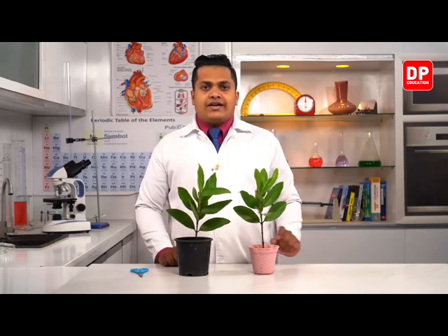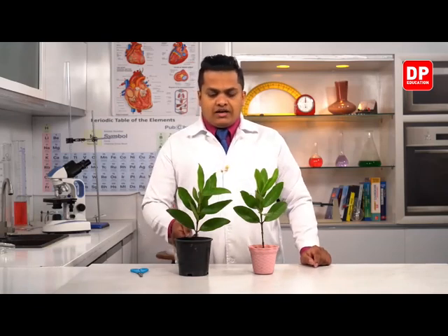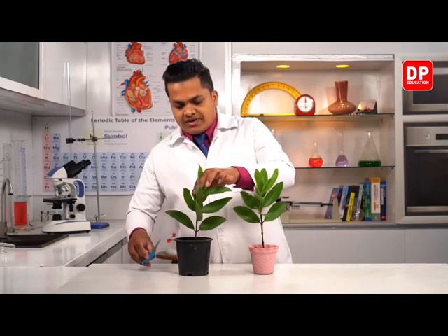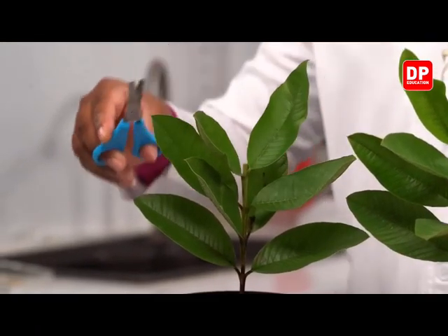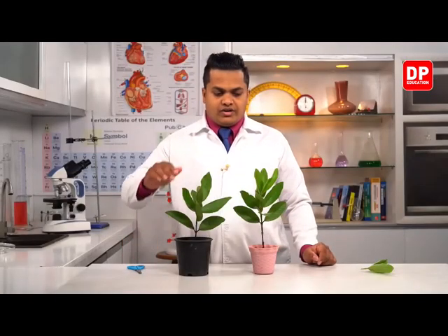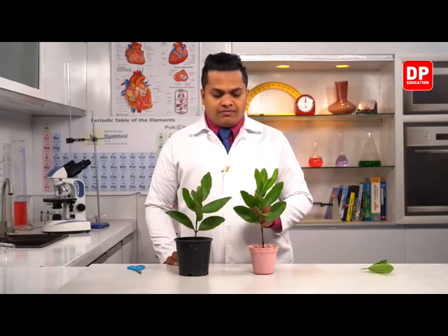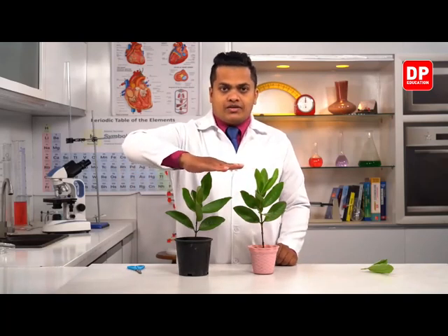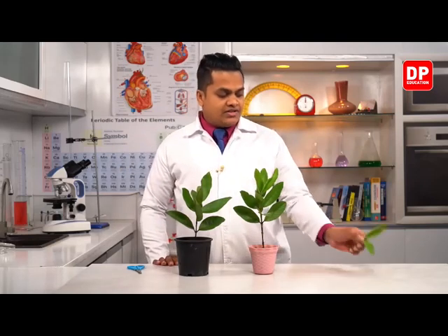Select one of these items and remove the apex of it. So I'll use this black color one and I'll remove the apex. So this is the apex, my dear children. So let's remove it. Okay, so I have removed it right now. So as you can see here, when you compare the height of the plants, it is around the same height. Remember it. It's around the same height, even after removing this apex part.